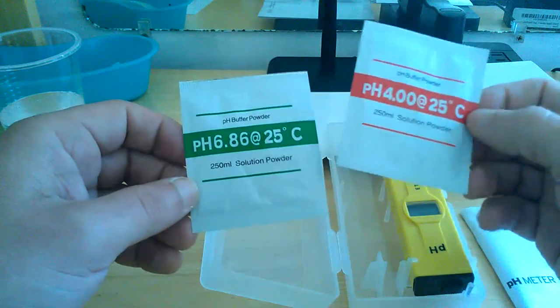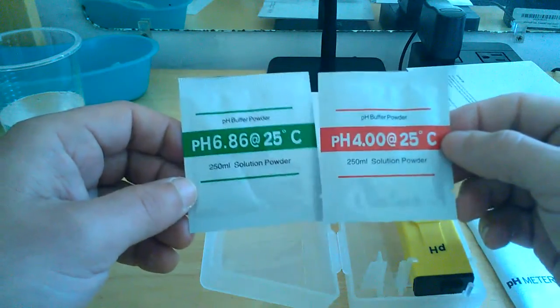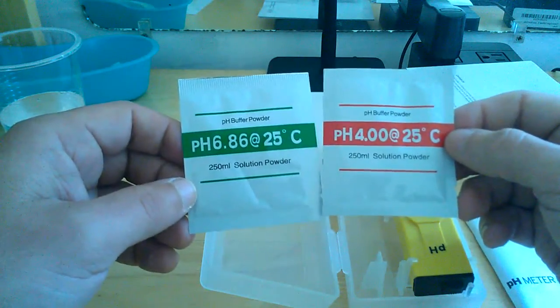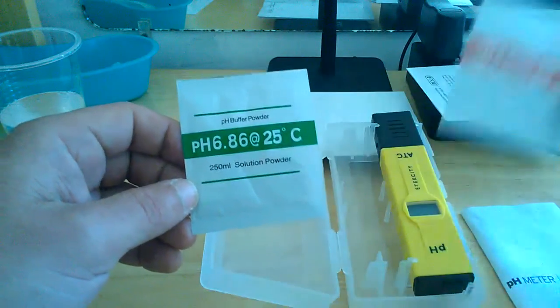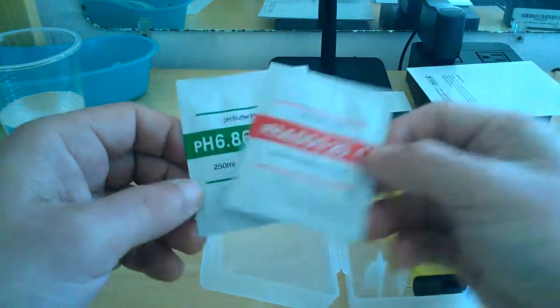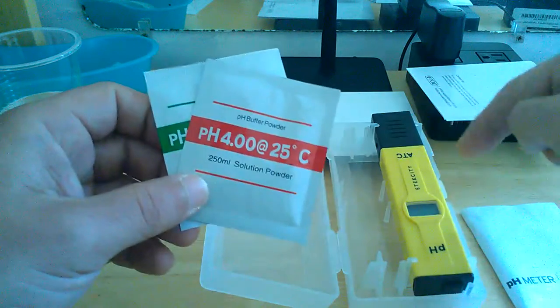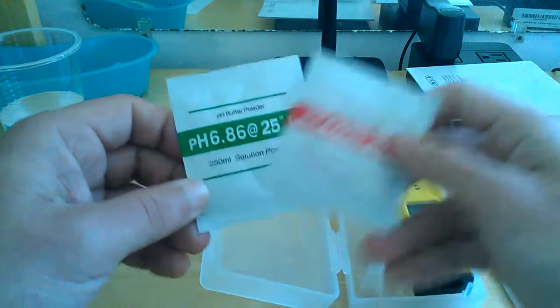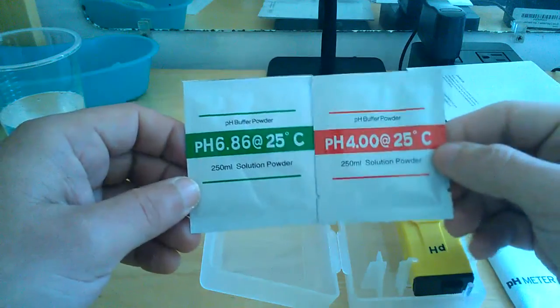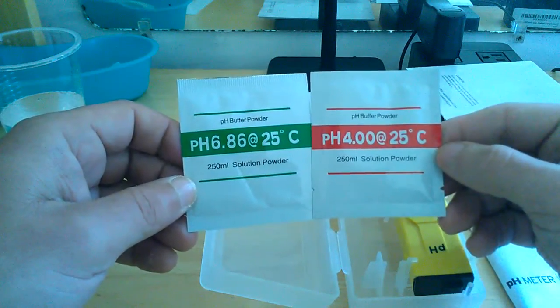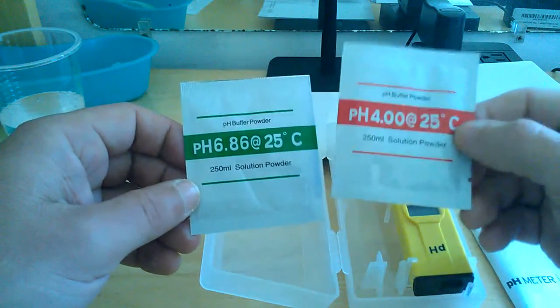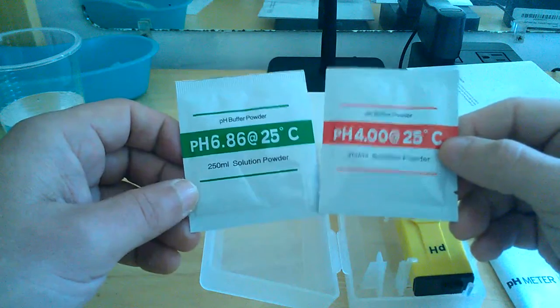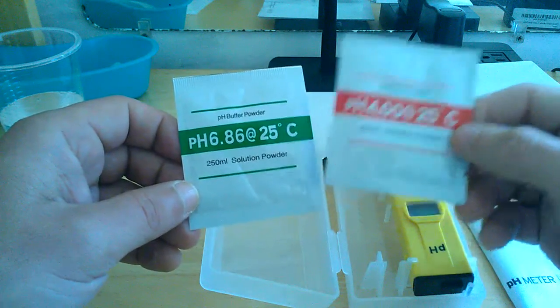Very simple to use these powders. You simply mix them with 250 ml of distilled water, mix them up until they're fully diluted. And that's when you insert your pen in it to recalibrate it. Then there's a screw and a tool that you use to get it ready, to zero it out. And then you're ready to very specifically test those products. That's what these powders are used for, the buffer powders.